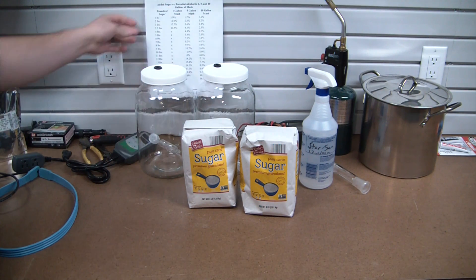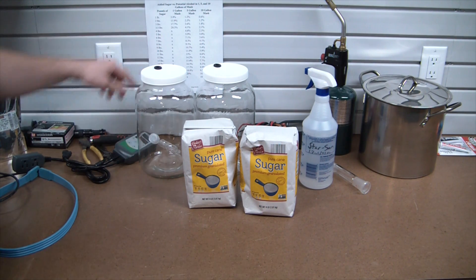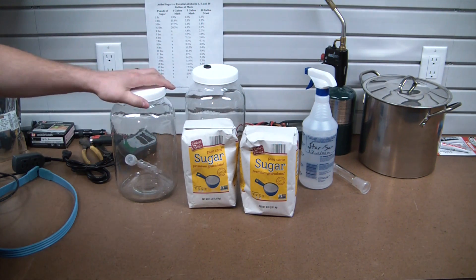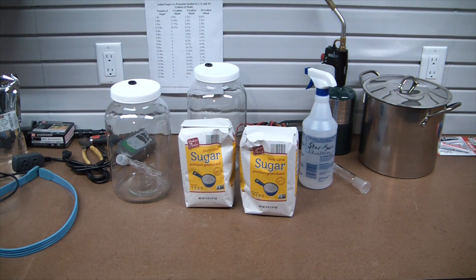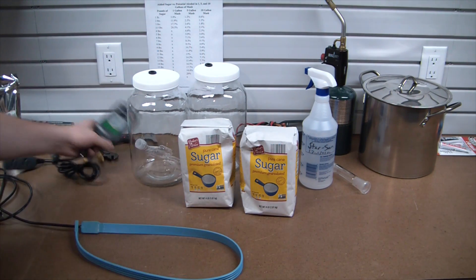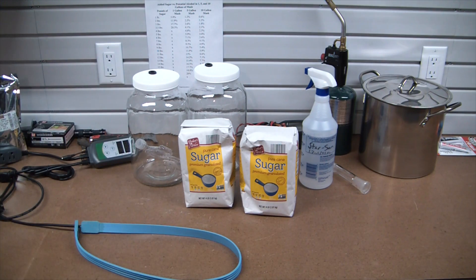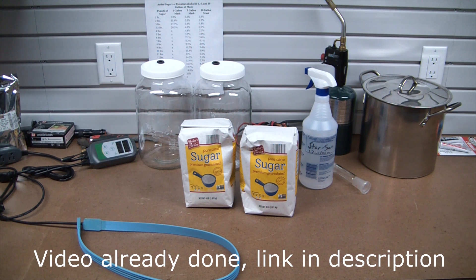Got my little distillers table here and it basically tells you how much sugar per gallon of mash gives you what percentage. These are some one gallon jars, we're gonna be doing three and a half pounds of sugar in each of these, just a hair under one bag, and setting it up to ferment. I'll put this heating belt on it with a little temperature controller, and after about a week's time we should be around 20% alcohol.